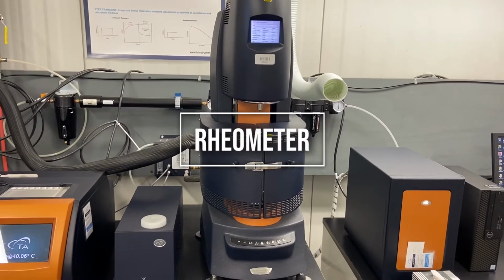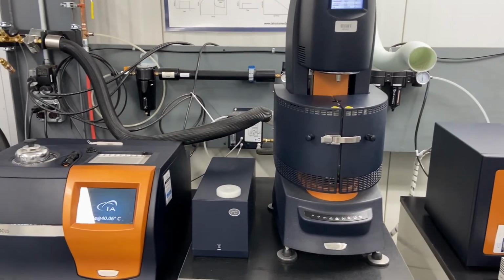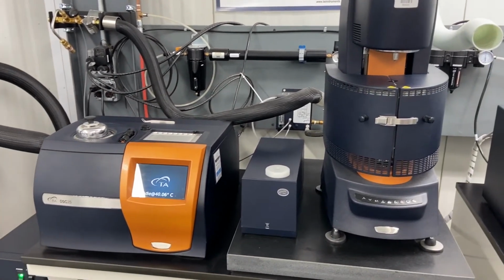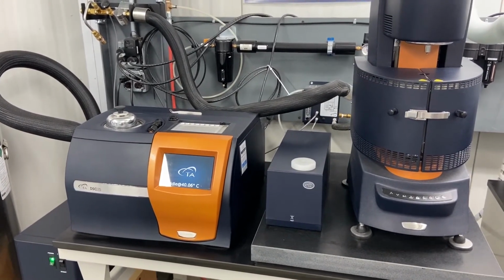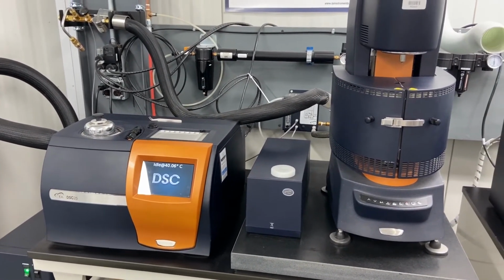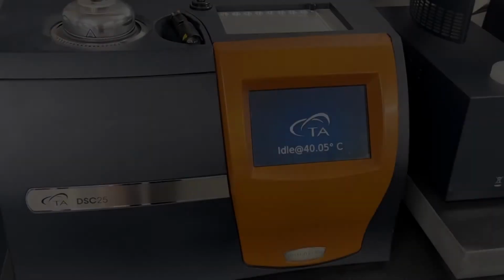The Rheometer is used to examine mechanical properties of polymeric materials. New England Wire Technologies utilizes the Rheometer to study the flow characteristics of polymer melts and solutions, characterize curing and cross-linking systems, and probe the behavior of finished jackets with temperature and fluid immersion.